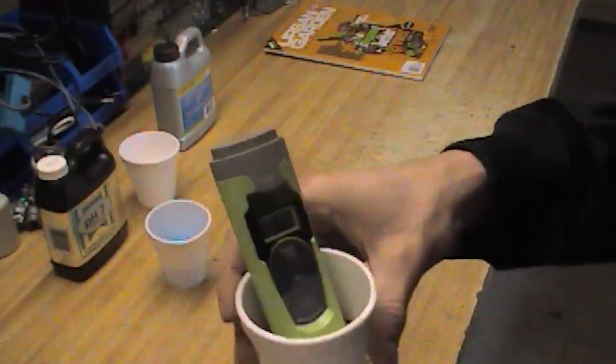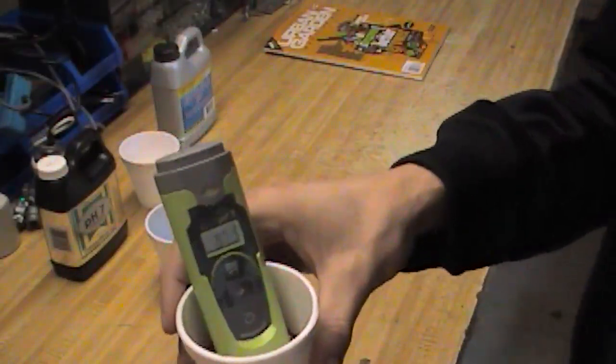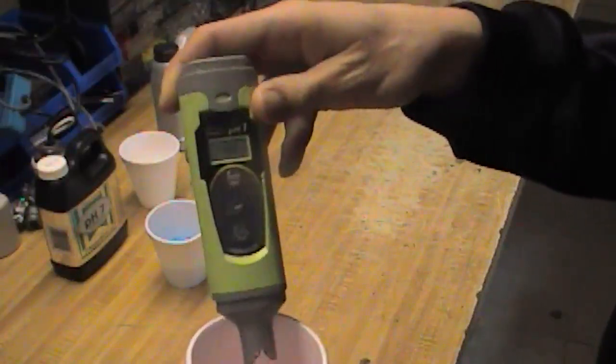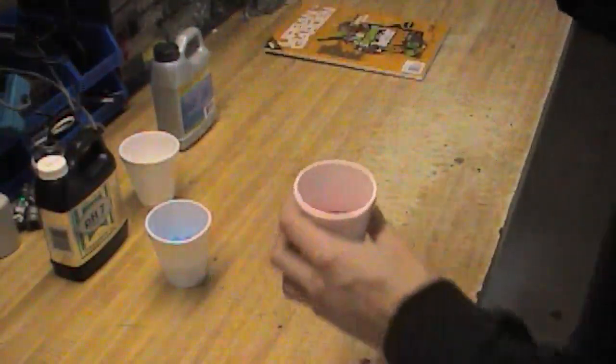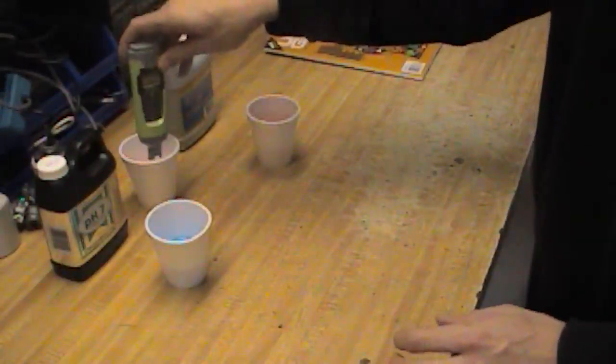Another good thing about the calibration is you get to see how long it's taking for your pen to read the pH. You get to determine how long you should be putting your pen into your nutrient solution in order for it to equalize and give you a proper readout.